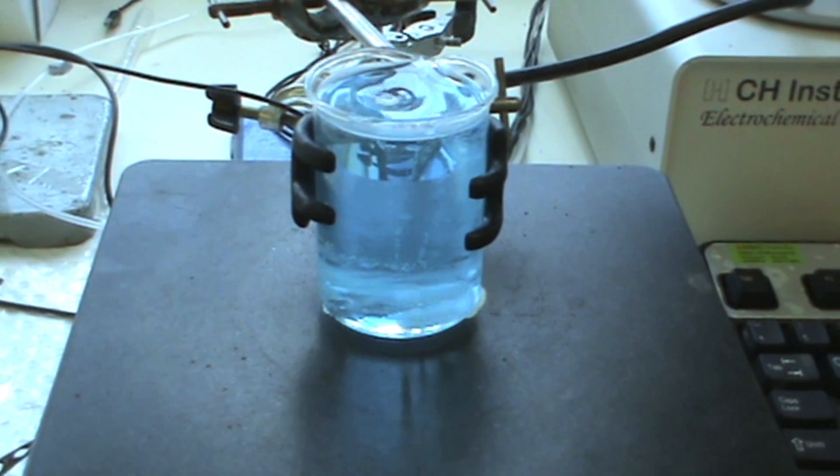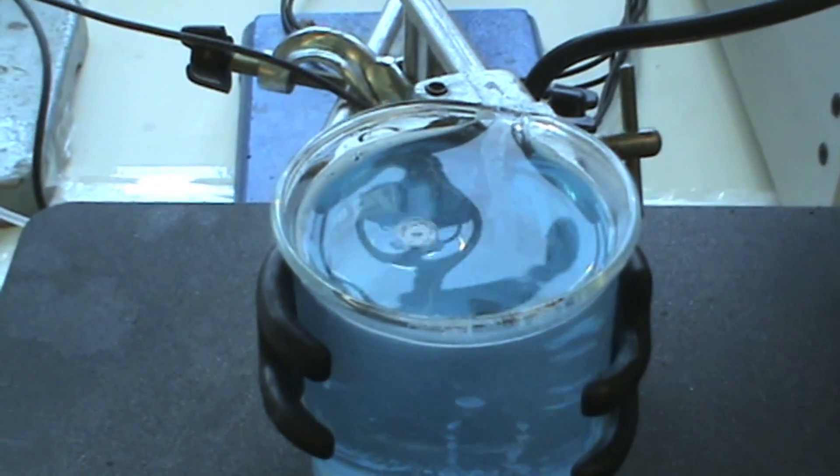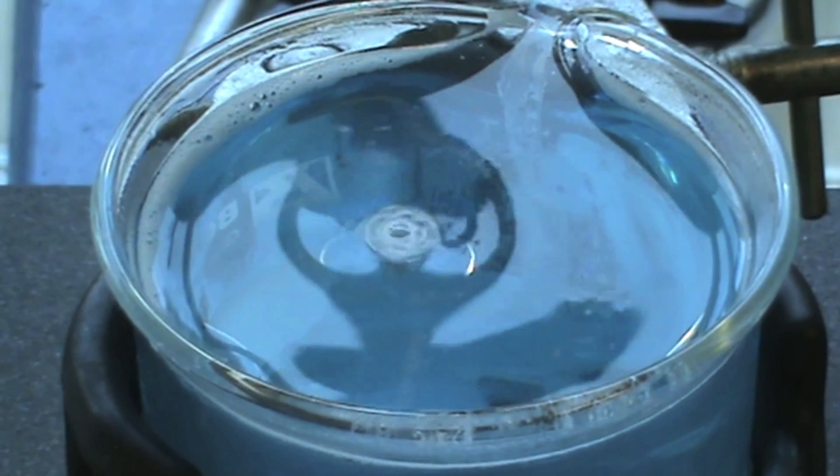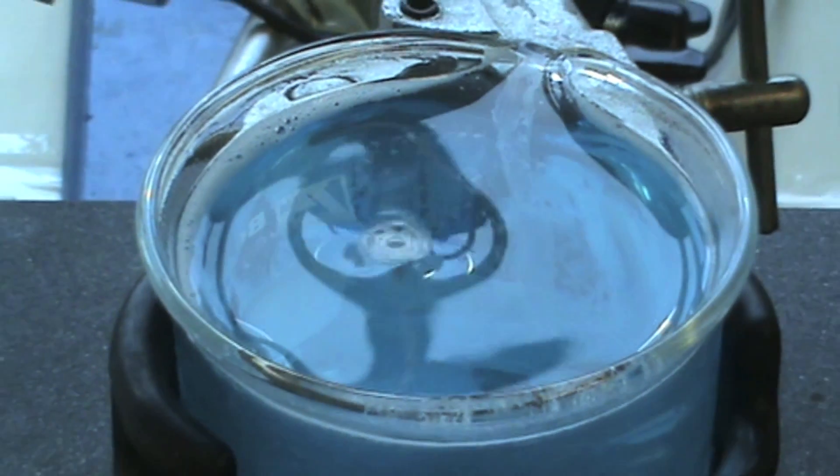The CTAB will take longer to dissolve. As the temperature increases, the CTAB will eventually all dissolve, and you will be left with a clear blue solution.